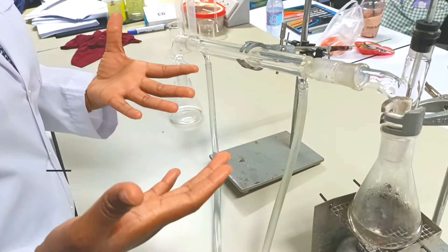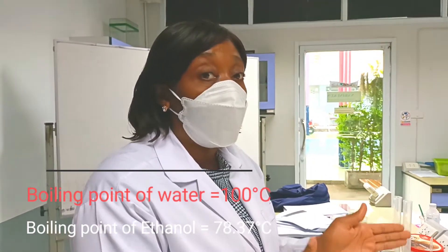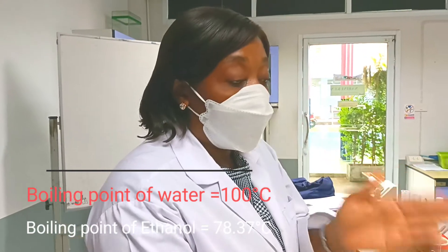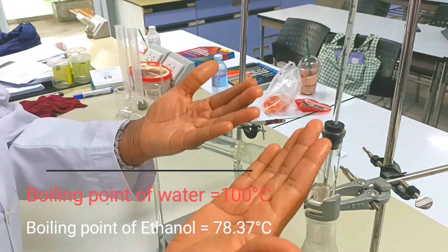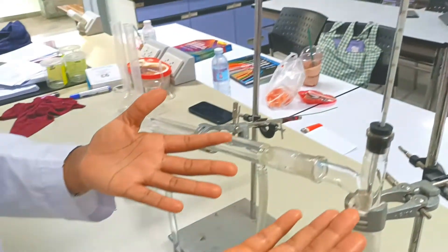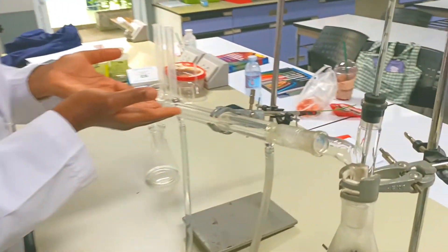Water and ethanol have different boiling points, so ethanol is going to boil faster than water. At the boiling point of ethanol, which is 78 degrees Celsius, it's going to vaporize — which means it will change from liquid to gas. This gas will be passed through the condenser.